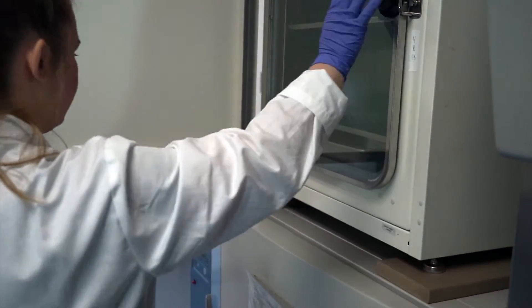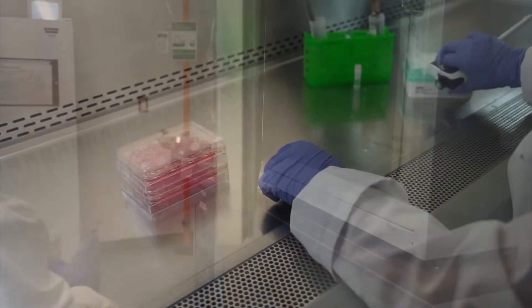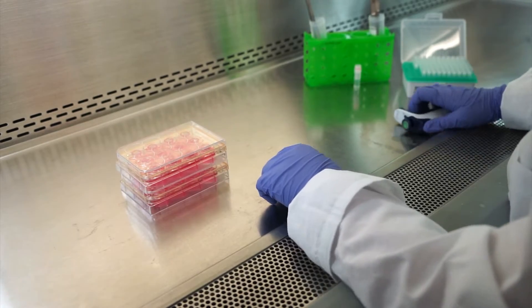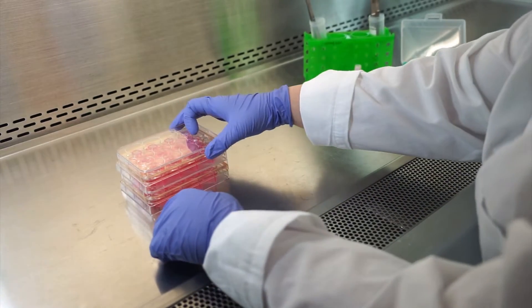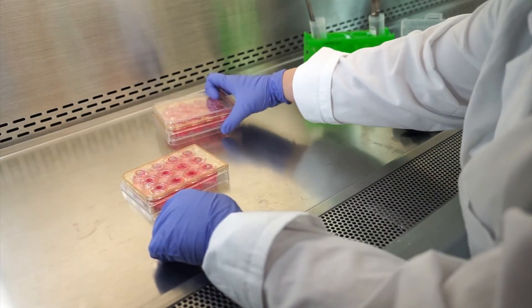After the overnight equilibration, the tissues are removed from the incubator and the media is replaced with fresh media prior to dosing.